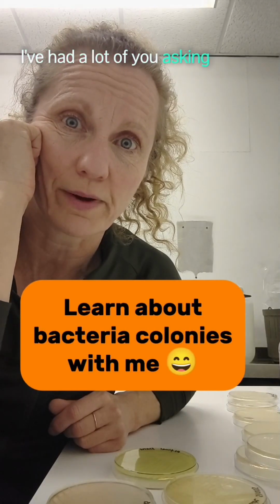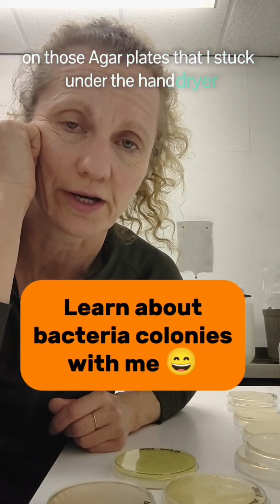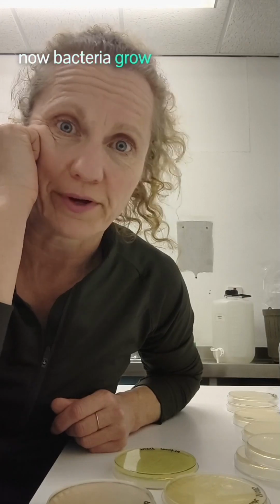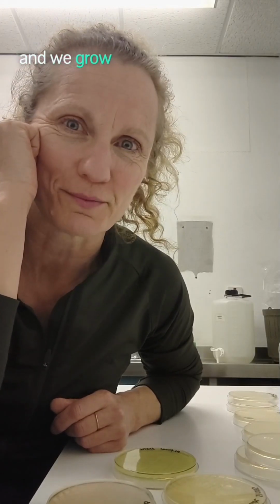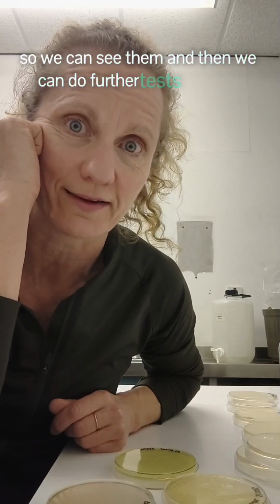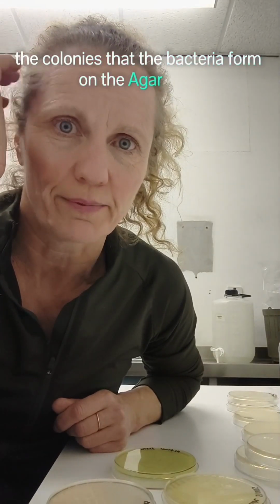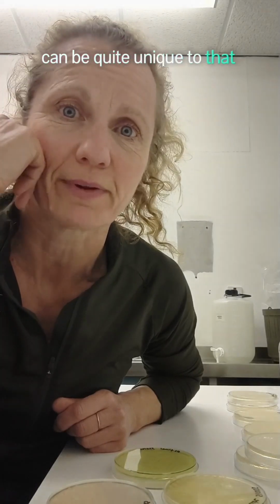I've had a lot of you asking about the different kinds of colonies on those agar plates that I stuck under the hand dryer. Now, bacteria grow on agar plates, as you know, and we grow them up so that the colony is big enough so we can see them, and then we can do further tests on them. Colonies that the bacteria form on the agar plate can be quite unique to that bacterium.